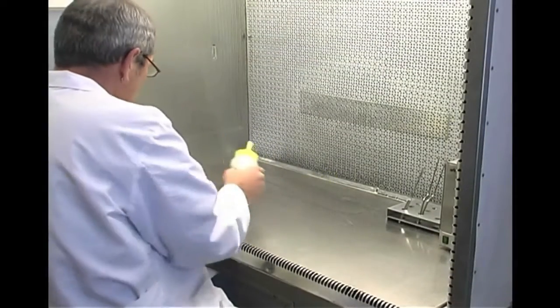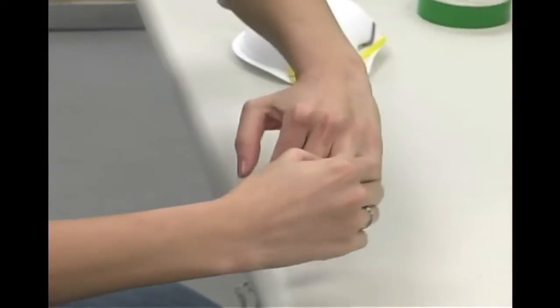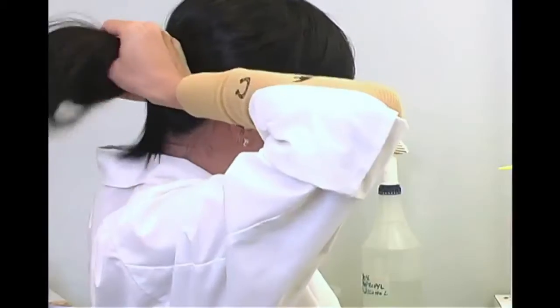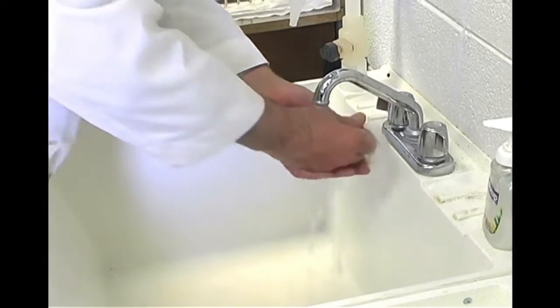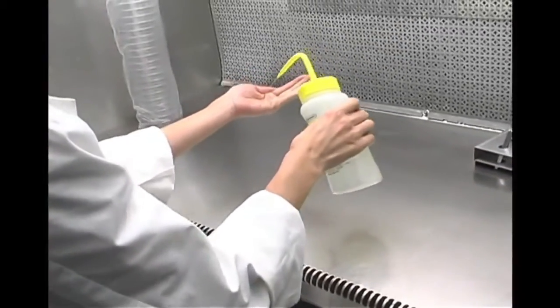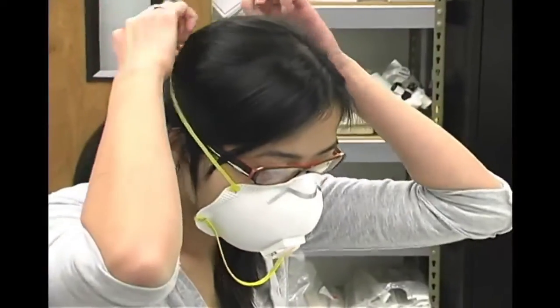You should always be aware of potential sources of contamination such as dust, hair, hands, and clothes. All jewelry should be removed, hands washed, sleeves rolled up, and long hair tied back. Hands should be washed, not scrubbed. Scrubbing dries hands and creates flakes of skin that have bacteria. Hands should be sprayed with 70% ethyl or isopropyl alcohol, or coated with isopropyl alcohol gel. Gloves and masks provide extra protection.